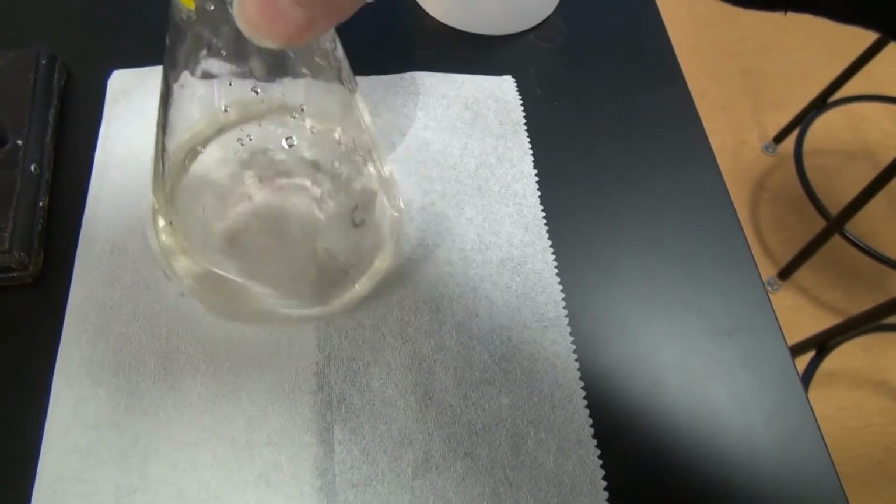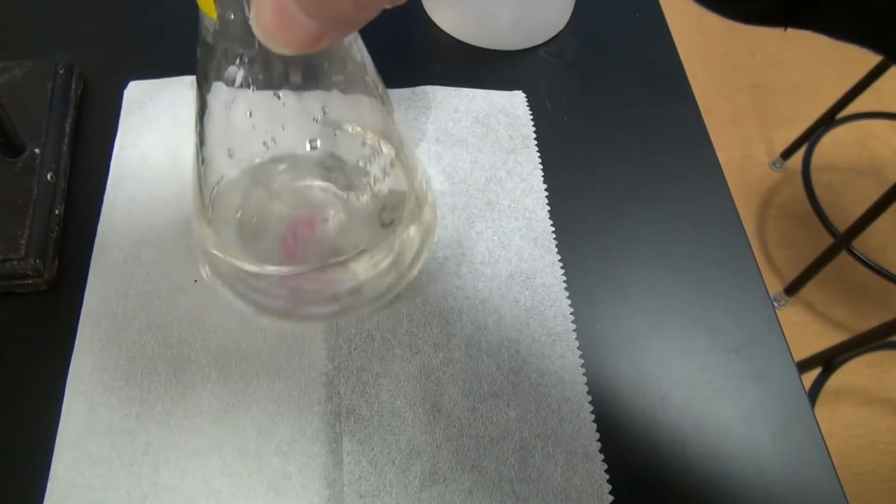And when we get close to 6 here, I'm going to stop it and we'll do drip by drip.